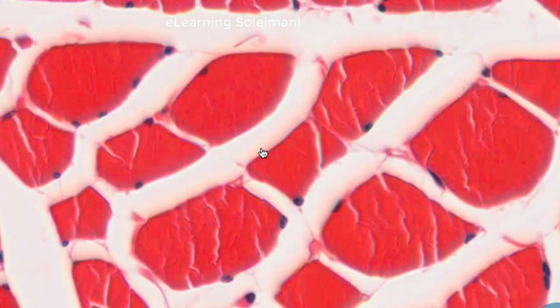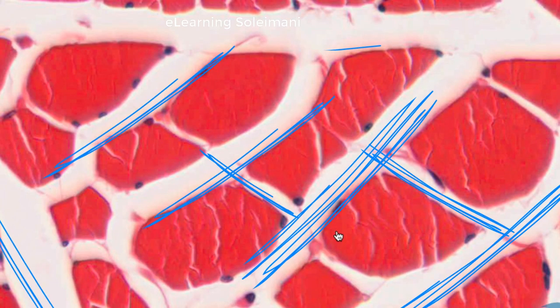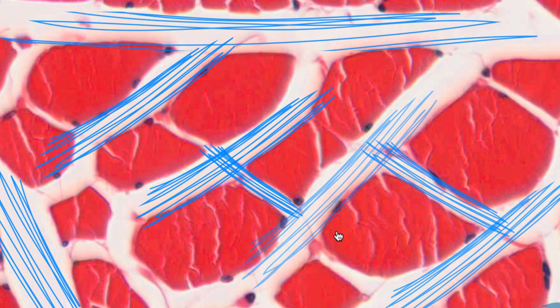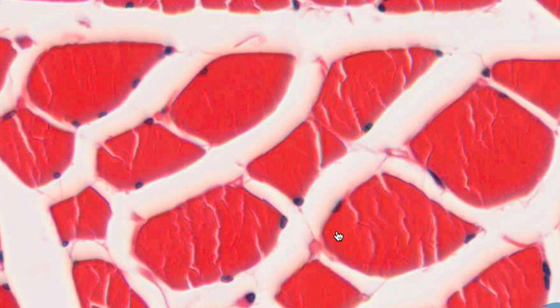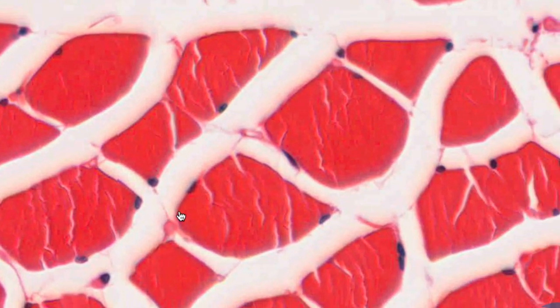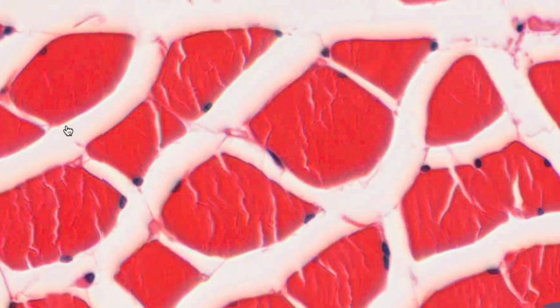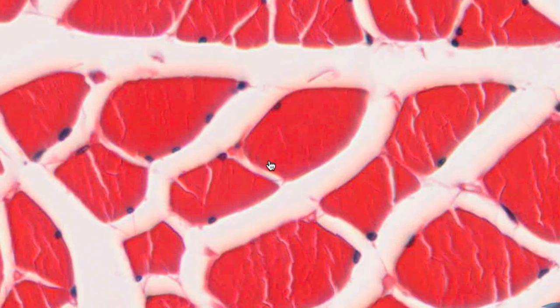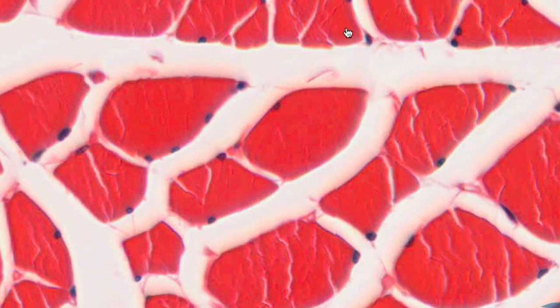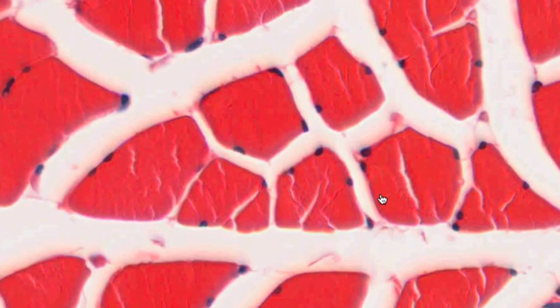The bright spaces between the cells indicate the location of the endomysium. Due to excessive dehydration during tissue preparation, the extracellular space in this slide has expanded beyond the expected range.